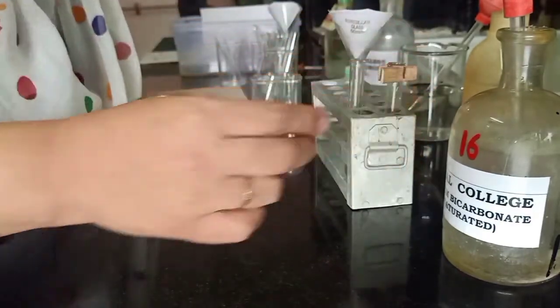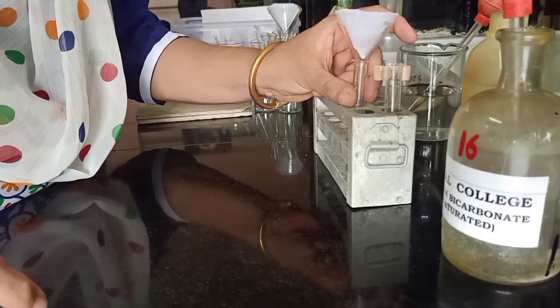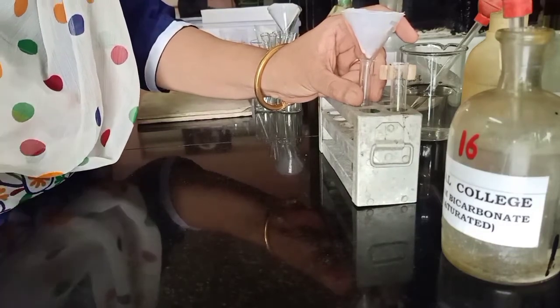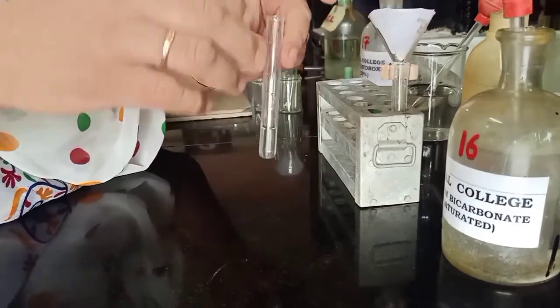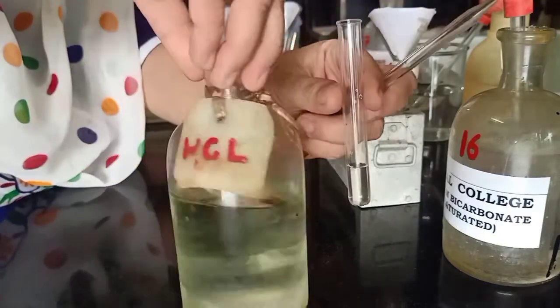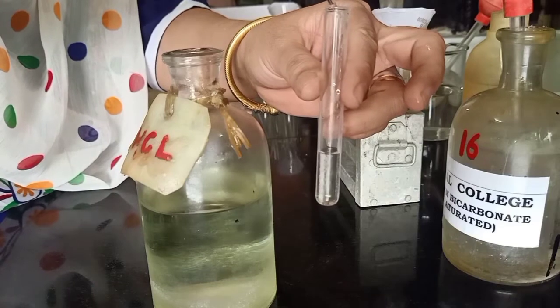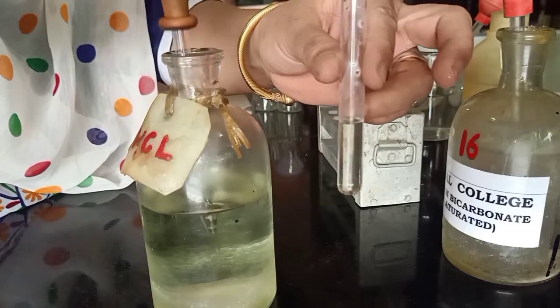Now we check for re-precipitation. One precaution to remember when doing the determination of type is to take the entire sample and not take fresh mixture for every succeeding test. The sample has to be taken entirely for the first test, and the succeeding tests are done with the residue left after the preceding test. We have the filtrate here and we check for re-precipitation — remember this is an acid, so re-precipitation will be checked with concentrated HCl. I am not getting any re-precipitation. However, I did get brisk effervescence on the addition of bicarbonate. So there could be a possibility that an acid is present, but because it is a water-soluble acid that is why there is no re-precipitation.